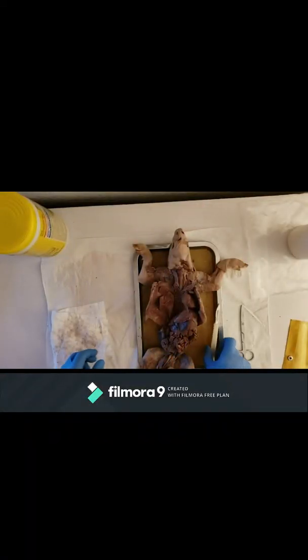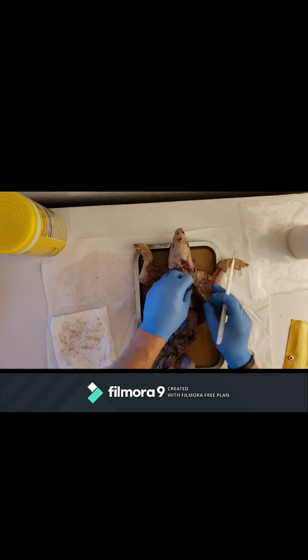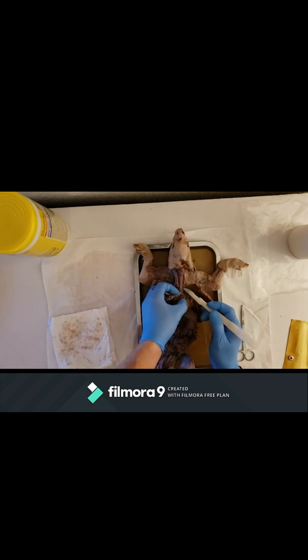Good afternoon, this is Kevin Stinson for Bio 251 fetal pig dissection. This video is going to be a combination of the respiratory system and the lymphatic system, because I think we can cover both in the allotted time. So the lymphatic duct, it's in the inferior portion of the neck, and it's right here.